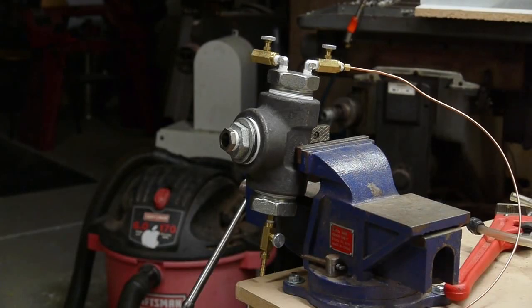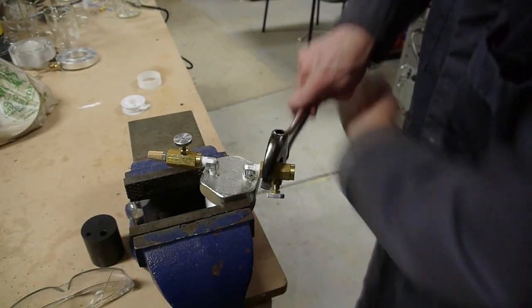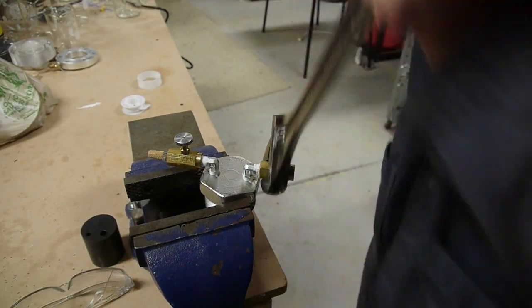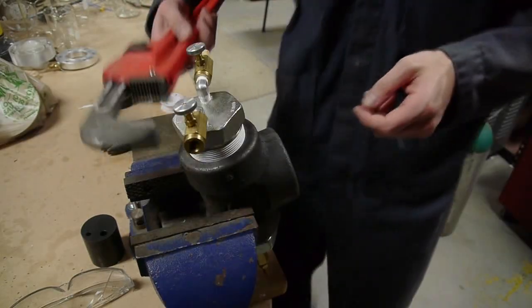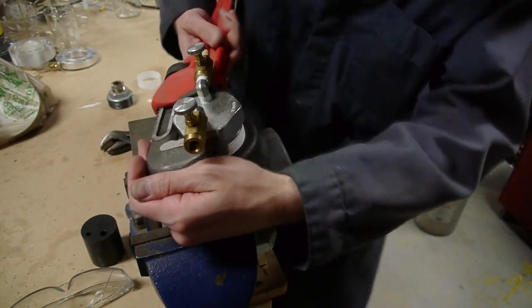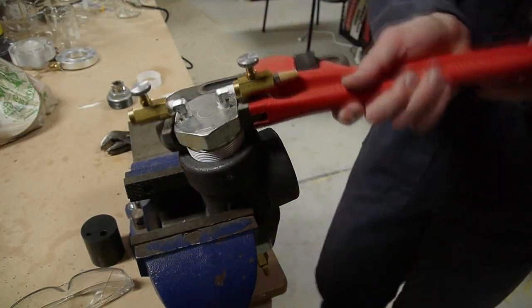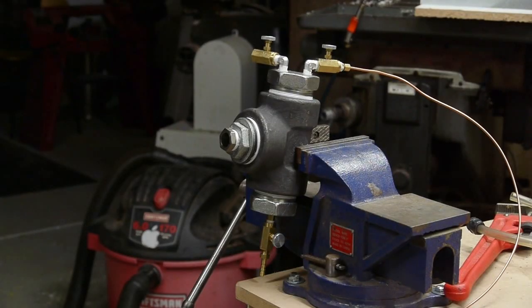I'll do a video on actually making the aerogel later, but I thought I'd just show you this. Putting it together was pretty straightforward. It did leak a fair bit, so I had to use lots of Teflon tape. I don't think it's leaking now.